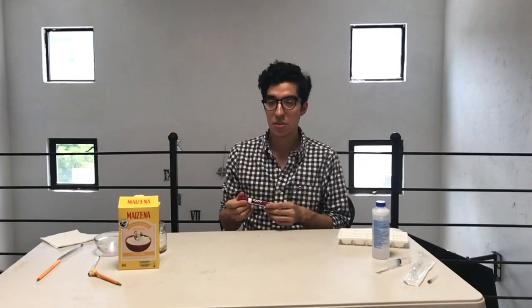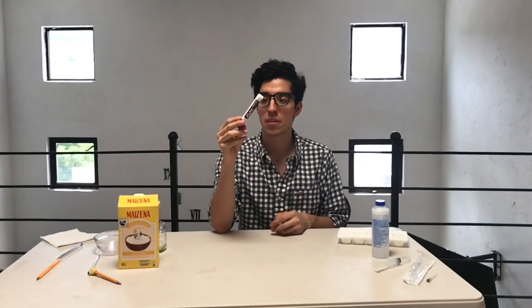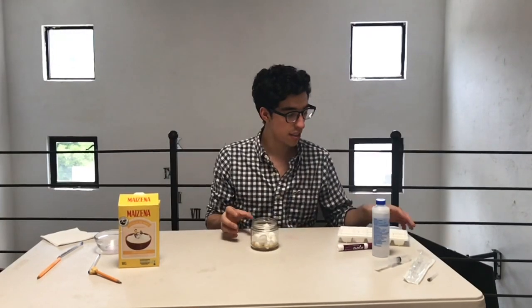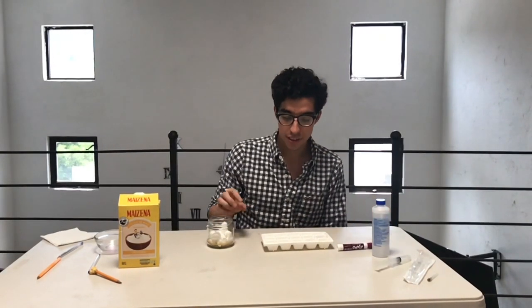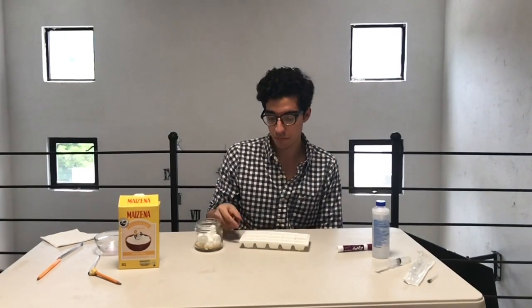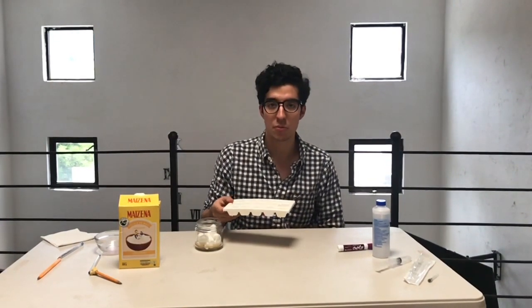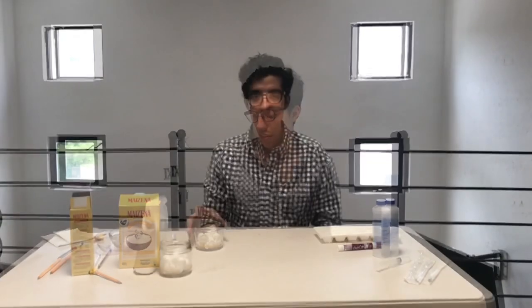In this case, we are using this marker as our vegetable colorant because I don't have colorants here, but it is easy to use. We only need to extract a little of the color. Then we have this and this. First of all, we use the ice cube palette to put our extractions with the drops that we will extract. Then we have the cotton.